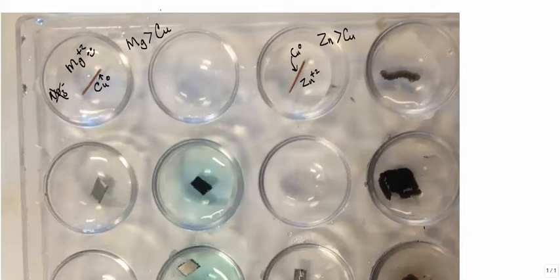But here in our last of our copper examples, we have silver ions, happy, and copper metal, not happy. But notice the fuzziness that you see there. That fuzziness is very different from the lack of fuzziness. In this case, a reaction has occurred. Copper is active enough to give 1 electron away to silver. Actually, it's going to take 2 silvers to completely satisfy the copper.